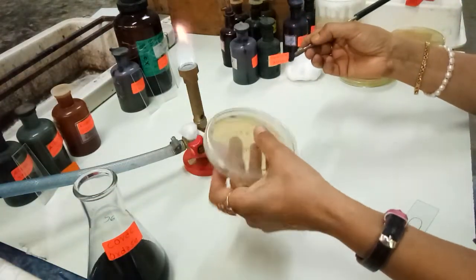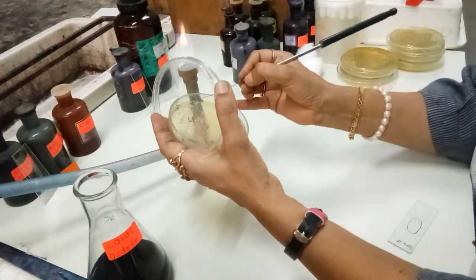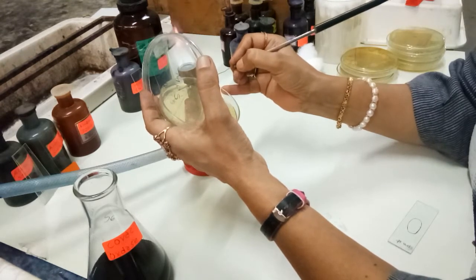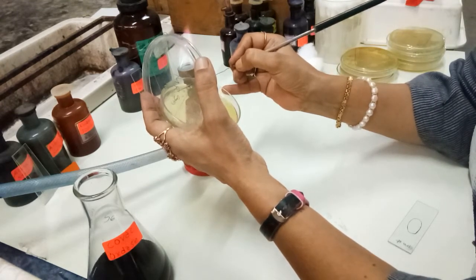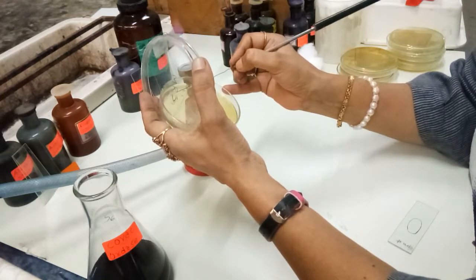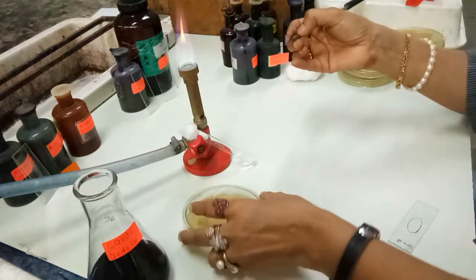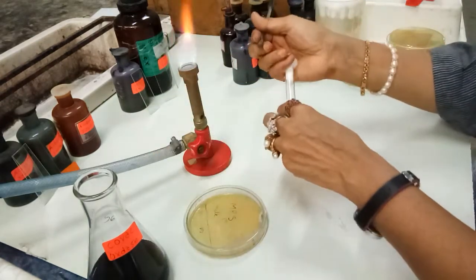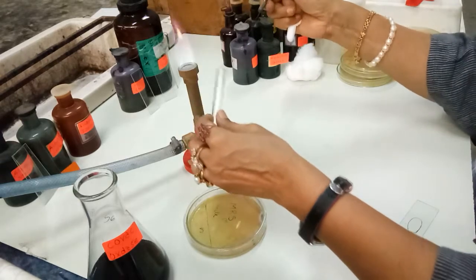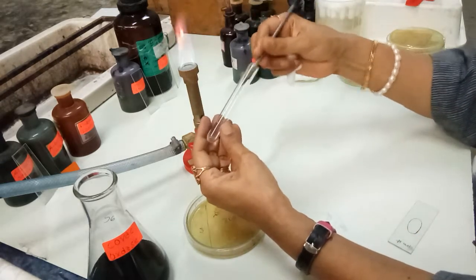I am going to collect the colony. You should always mark your colony before you go for any further procedure, so you know where your colony is on the media plate.